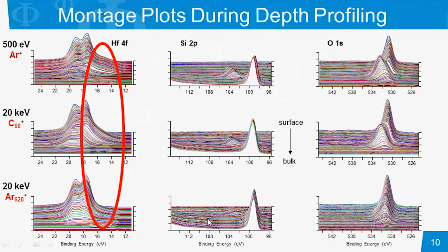Now, one thing that is interesting is if we look at the oxygen spectrum. Starting in this area, this would be our hafnium dioxide, and then this peak shift is representative of the transition into the silicon oxide layer. Now, with the argon gas cluster, we really do not see a dramatic shift, even though this was the same sample used in all three cases.